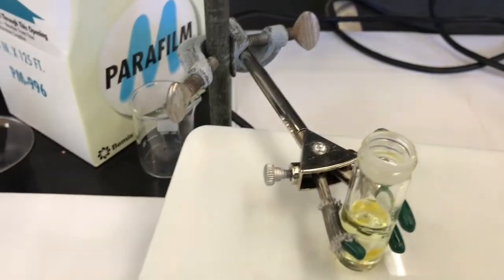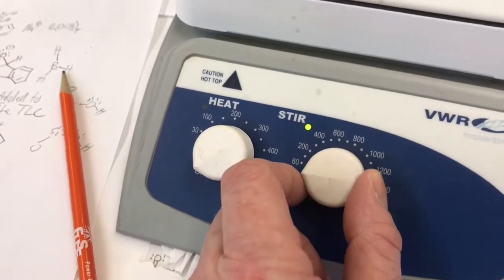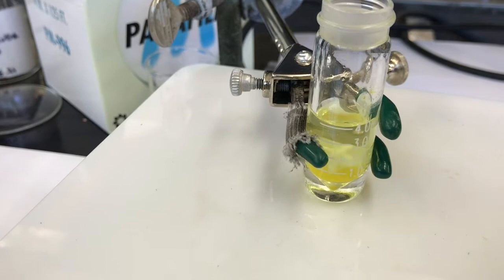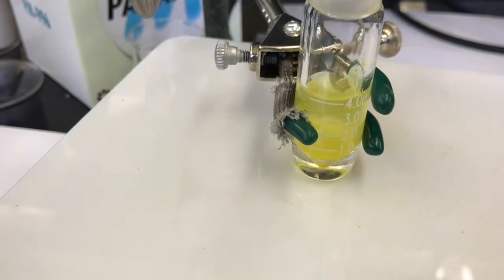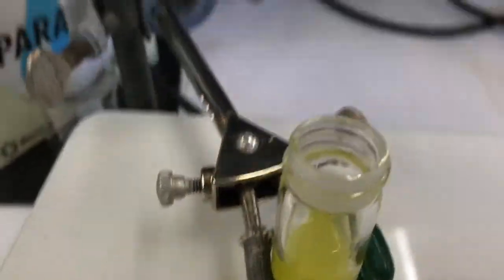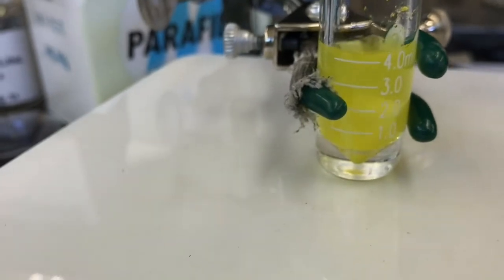So at this point, it's not all dissolved, but let me stir it. I'll get it dissolved, I bet. I'll turn on the stir. Make sure I'm turning on the stir, not the heat. I often have students accidentally heat this reaction, turning the wrong knob. So it's stirring. Let's see if it dissolves at all. A lot of times when you stir, you can get a nice whirlpool vortex in there. Let's see how ours looks. Looking kind of nice. It's a smaller volume, so it doesn't quite give you as cool a vortex. I'll try to speed it up, see if I can get a little more of a vortex.